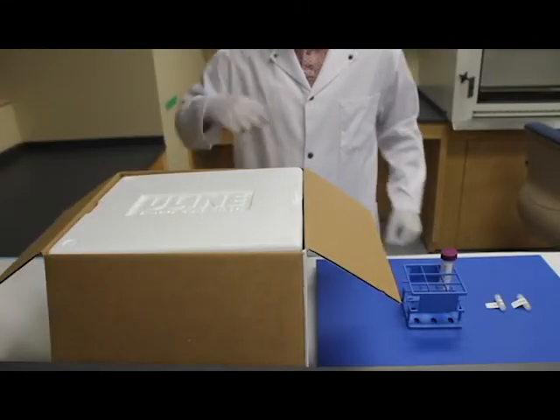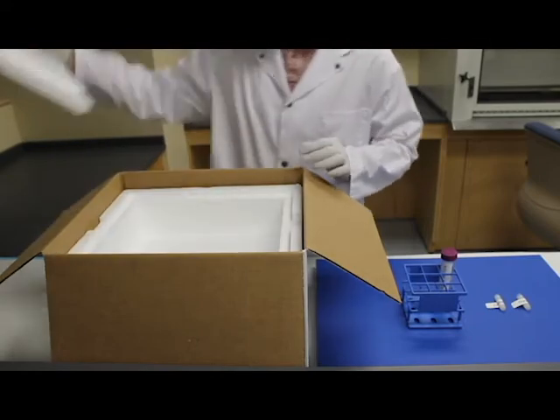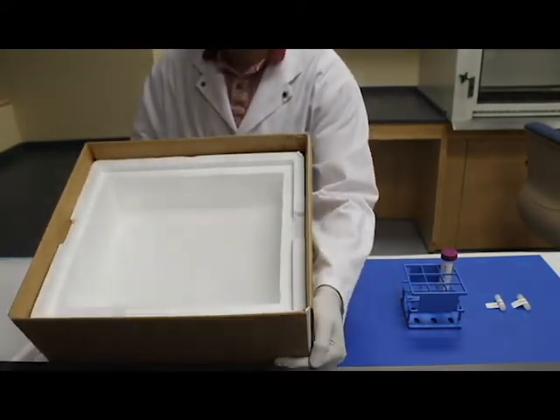Now you can prepare your shipping container. Fill the styrofoam container approximately half full with dry ice.